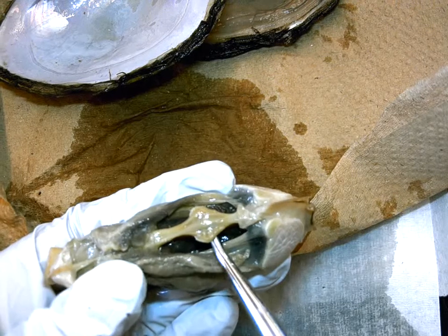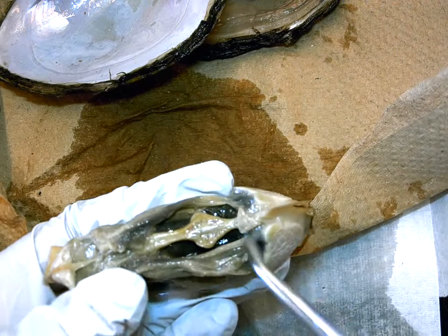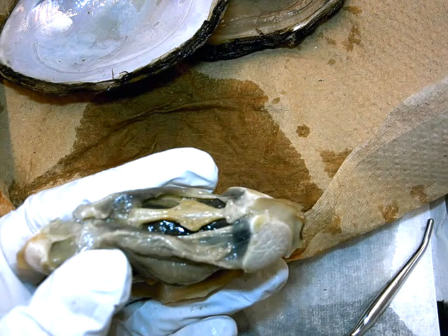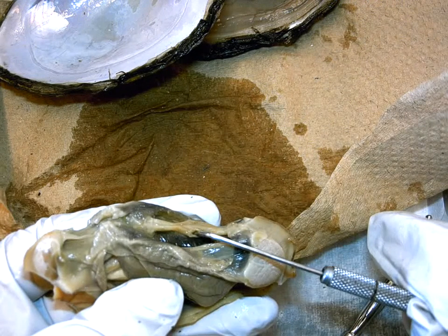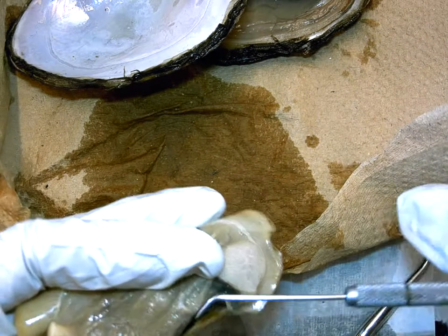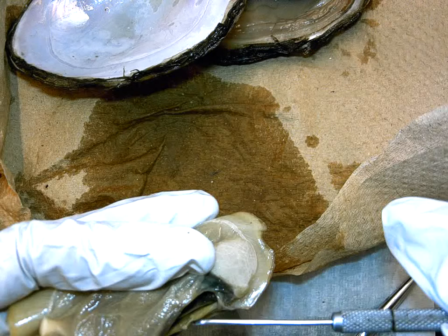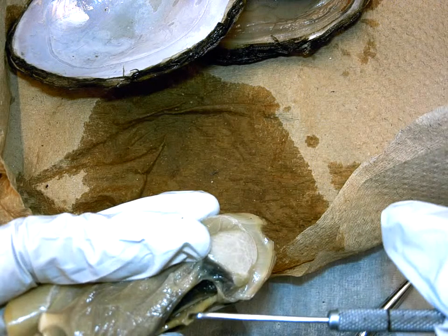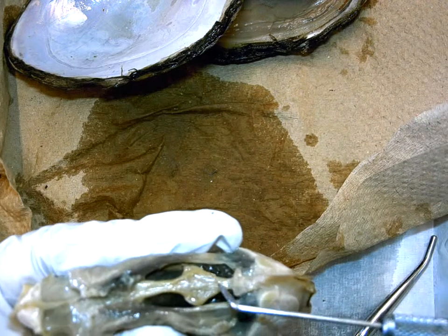The other thing you need to see is that it is a three-chambered heart, and this area is called the pericardial sac. If I turn the heart — let me get a more pointy probe — you'll see the heart actually has holes in the sides of it, which I'm putting the probe into right now. The other side leading into the other auricle is another hole. These holes on the sides of the heart allow blood to drain into the heart before it pumps it out.